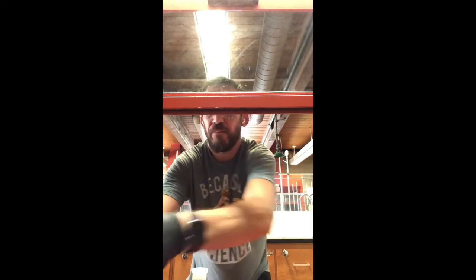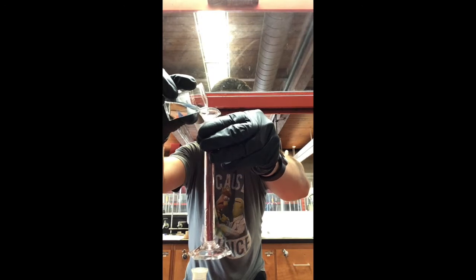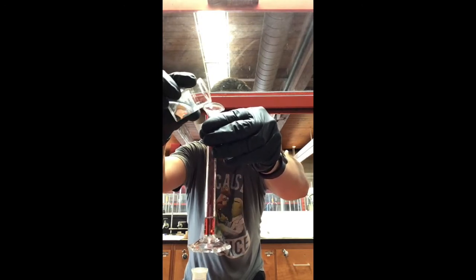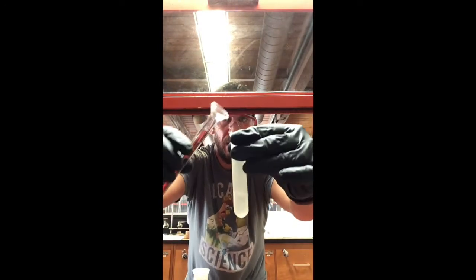All right, so let's go ahead and get that 2 mLs. Ooh, that's perfecto. So I'm going to go ahead and pour that in here.